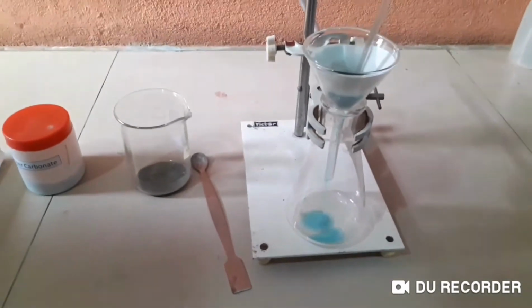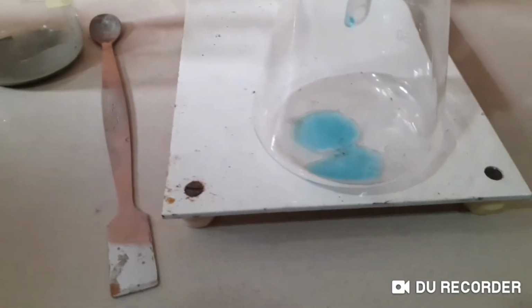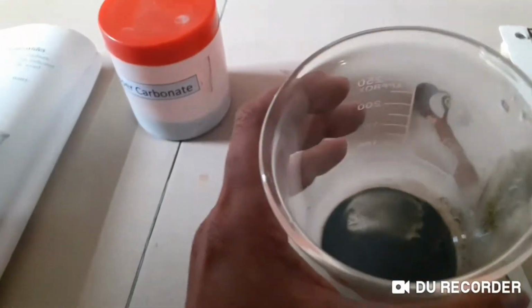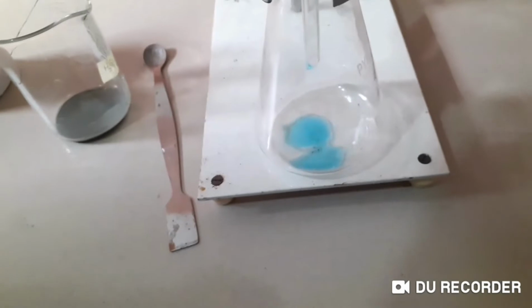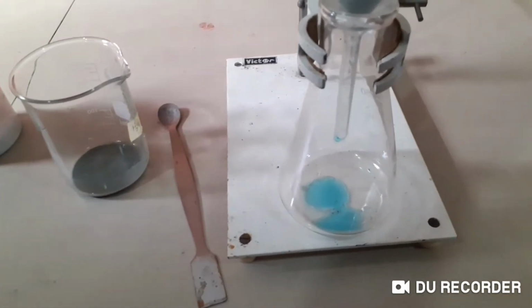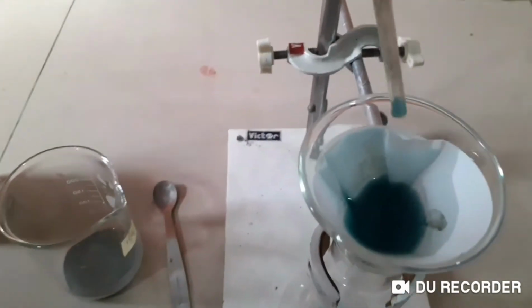Right, watch it. You can see that color is actually correct, right? That is copper sulphate color. You know that, okay? It's copper sulphate color. This is copper carbonate remaining. Yeah, darling, this nice color, but we'll see after a while. Okay, you don't need to hold it now. Now it will fall, darling. That will fall down. Okay, right. We cannot shake it. That is remaining.